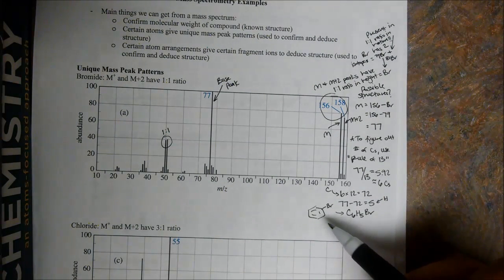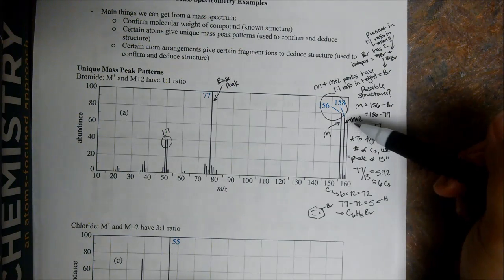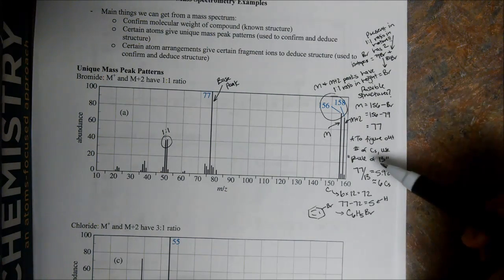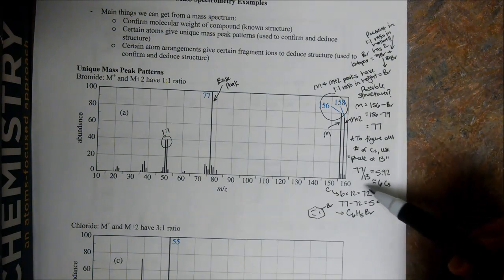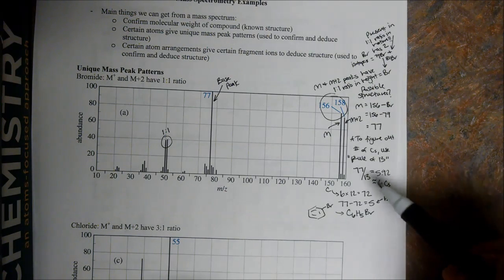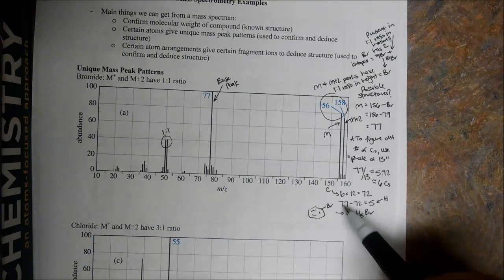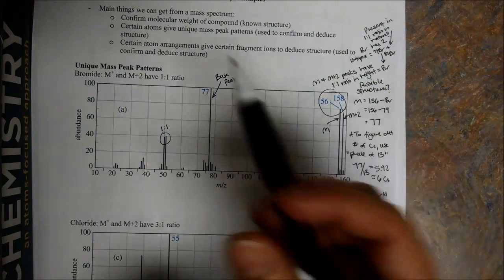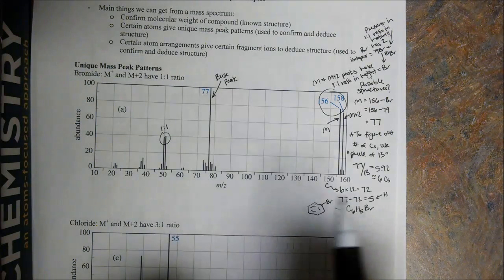Again, what I want you to take from this discussion is looking for the M and the M plus 2 ions being in a 1 to 1 ratio. And then from here, we can possibly figure out the number of carbons by using the rule of 13, which is simply divide the leftover mass units by 13, and we can get a rough estimate of the number of carbons that are possibly in our sample. Then we take the mass of the carbon to figure out how many mass units are left. We have 72 mass units for carbon, so 77 that were left minus 72, we get 5, so C6H5. Again, the main point here is that a bromide will have a molecular ion and an M plus 2 peak with a 1 to 1 ratio.